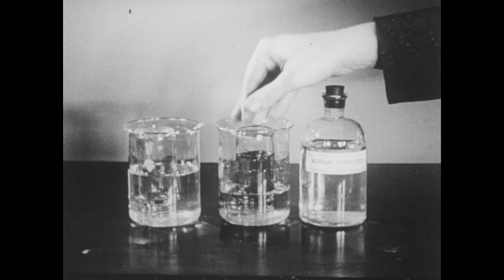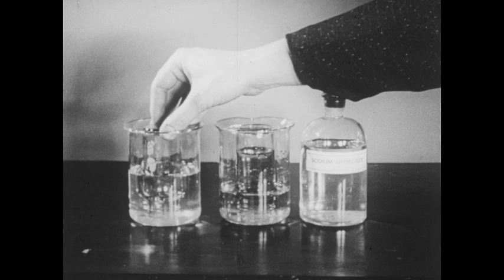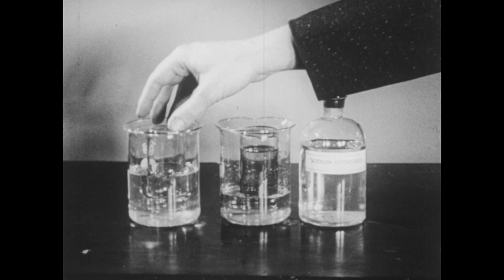You'll notice that the sodium hydroxide solution rather rapidly rises in the bottle. This indicates that hydrogen sulfide is an acid. In the other bottle, the gas has dissolved to a very limited extent. You can see that water has risen into the neck of the bottle, but the contrast between this bottle and the sodium hydroxide solution is marked.